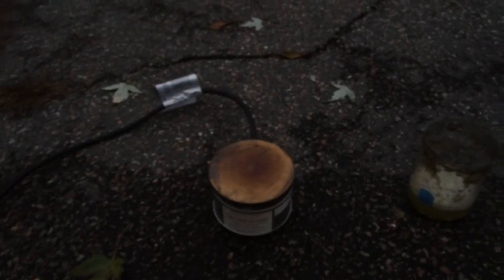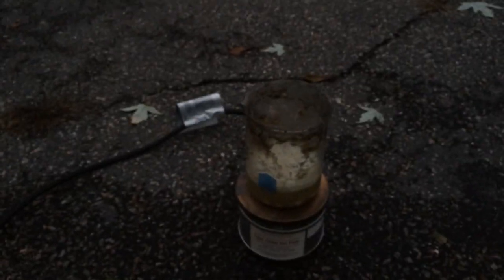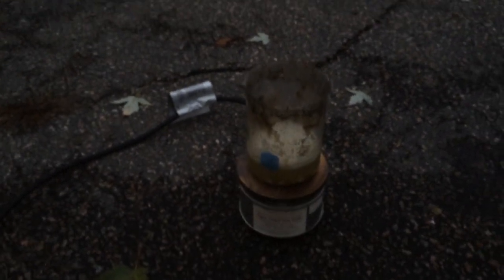Now, before it gets completely dark, I'm gonna add this to a hot plate so that it'll evaporate all the water and remaining hydrochloric acid, which will leave me, hopefully, with calcium chloride crystals.